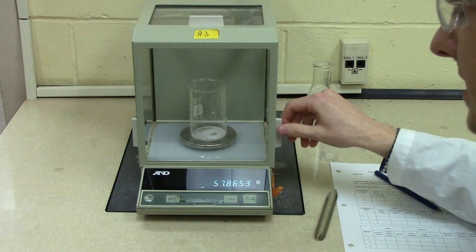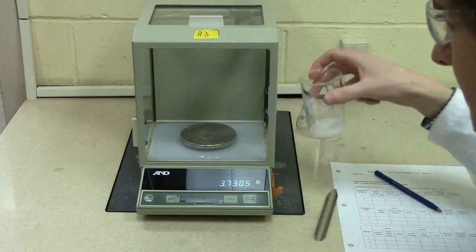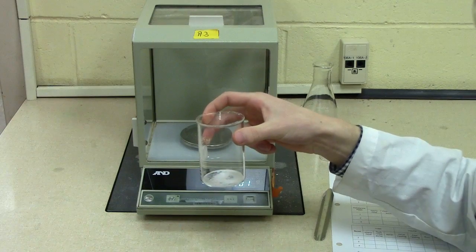With the mass of the empty beaker and now the mass of the full beaker, you can determine the mass of compounds within your beaker.